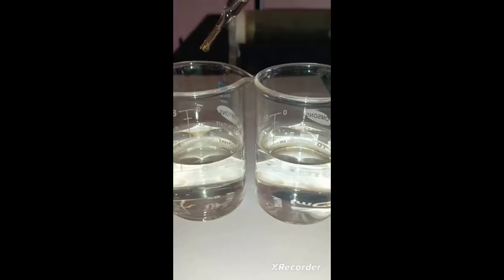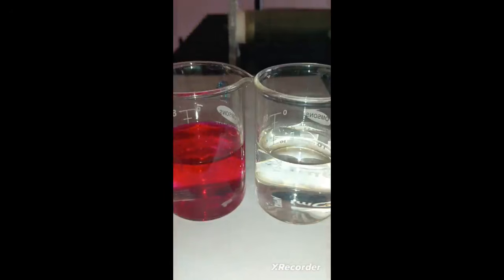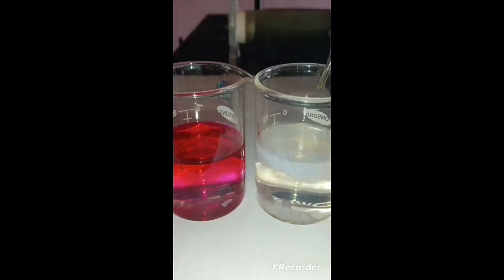When phenolphthalein is added to a base, it undergoes a chemical reaction that causes the solution to change color, turning from colorless to a vibrant pink or magenta. In acidic solutions, when the pH is below 8.2, phenolphthalein remains colorless. It does not react with acids, so the solution maintains its original appearance. In basic solutions, when the pH rises above 8.2, the molecule undergoes a structural change, resulting in a vibrant pink or magenta color. This color deepens as the solution becomes more basic.